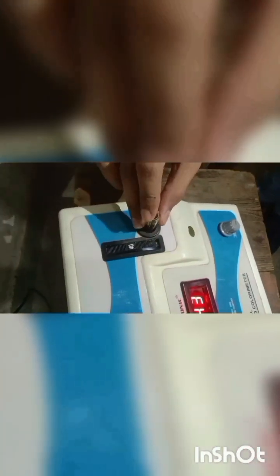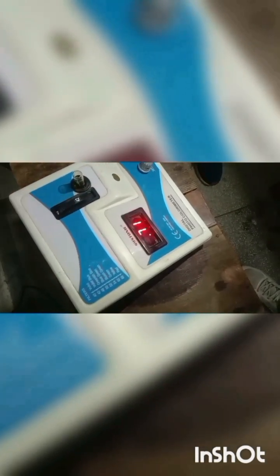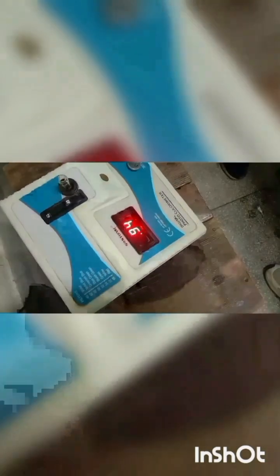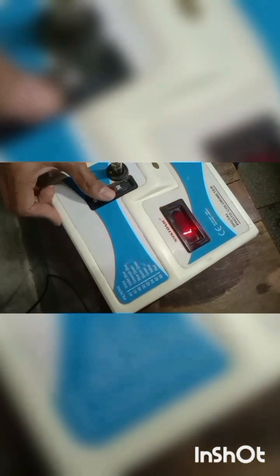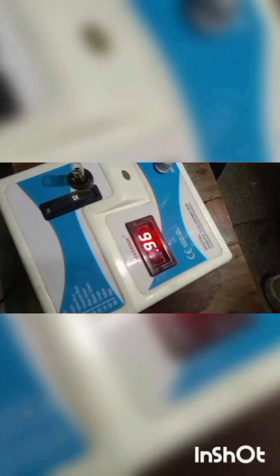Now taking the pure potassium dichromate solution in the cuvette, fill the cuvette and keep it in the colorimeter. Note down the value of lambda max — the wavelength at which maximum absorption takes place. At 420 nm the absorbance is 0.71, at 480 nm it is 0.94, and at 520 nm it is 0.96.